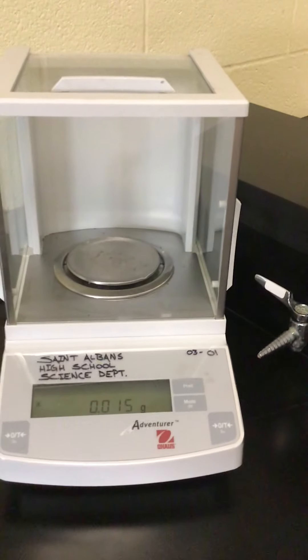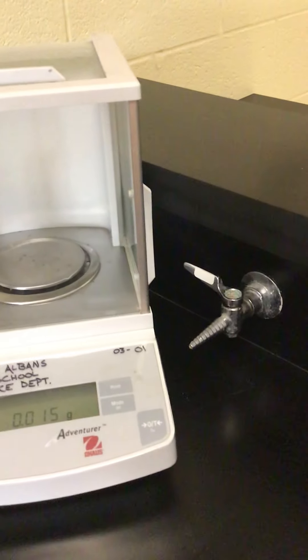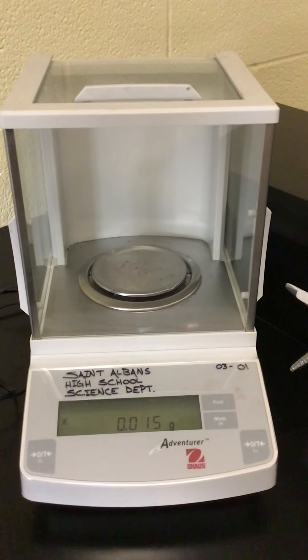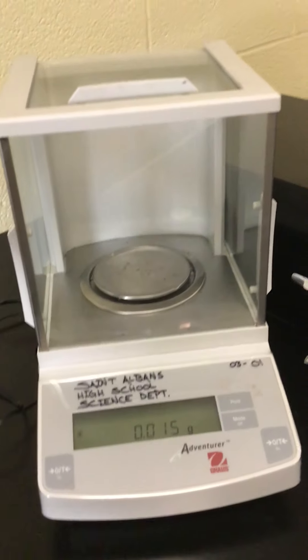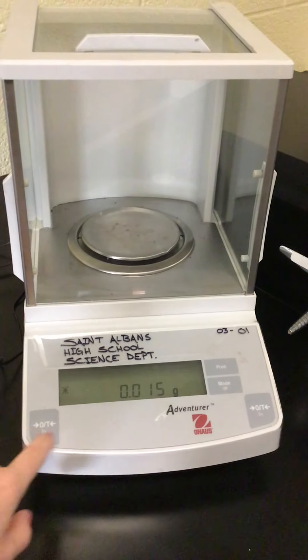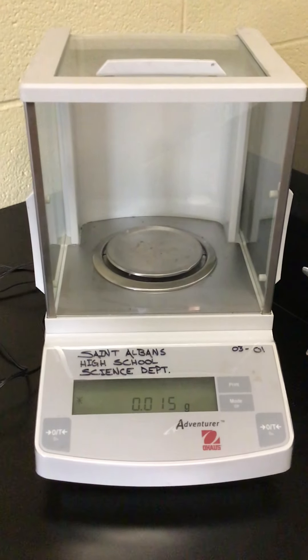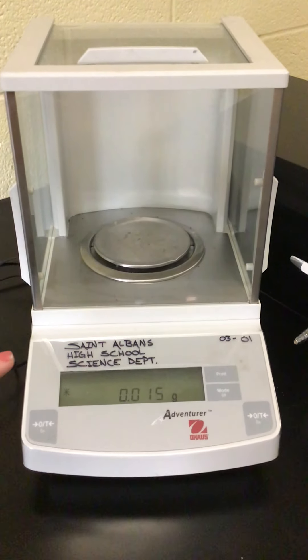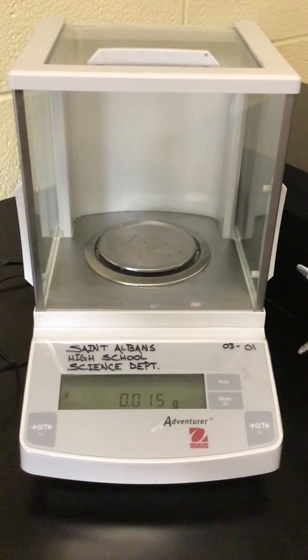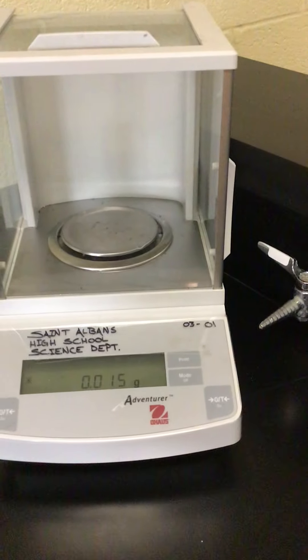A lot of you guys have probably never used a scale that is this precise or also this breakable. So I press this button right here to turn it on and you can see that it's already reading 0.015 grams but if I look inside at the plate there's nothing on there so that kind of poses an issue.